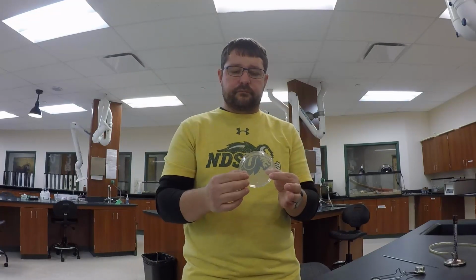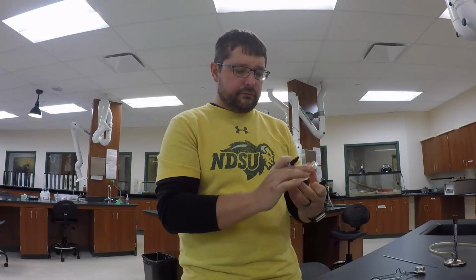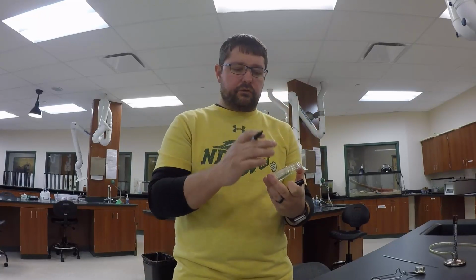Now, when I'm done with that, I'm going to put the lid on it, and then I'll write the time that it concluded at. Okay? So the next dish, and for most of you, you're actually going to do two of these dishes, would be a dirty finger, clean finger dish. And so what I want to do first is to the dish, I want to just draw a semi-straight line, and I say semi because it's not straight, down the middle of the dish. You can draw that with a ruler to be better than me. That's pretty easy.